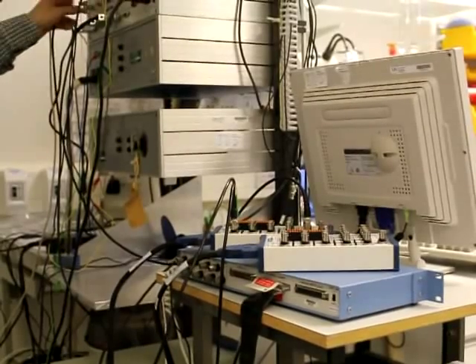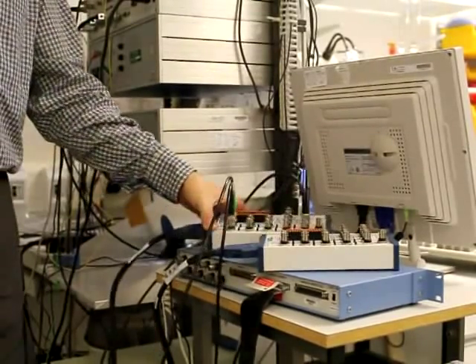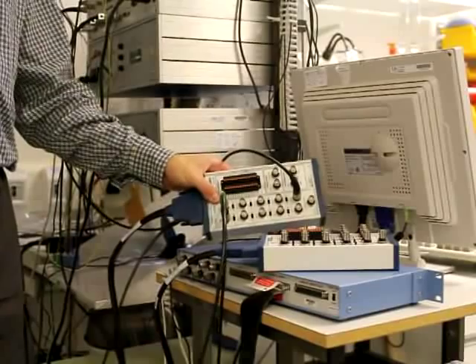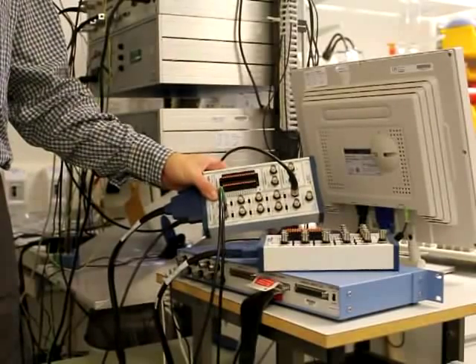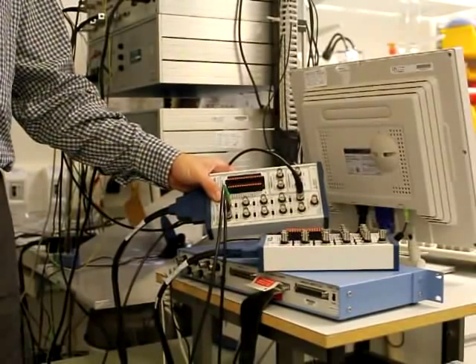here to our interface to dynamic clamp, which is the National Instruments board and the fitting connectors.